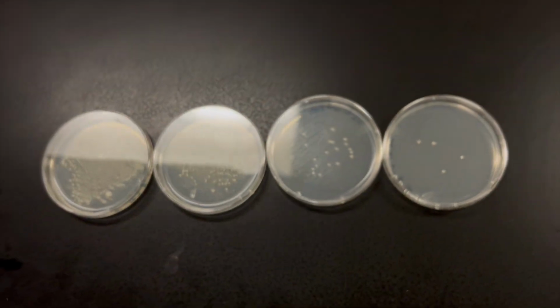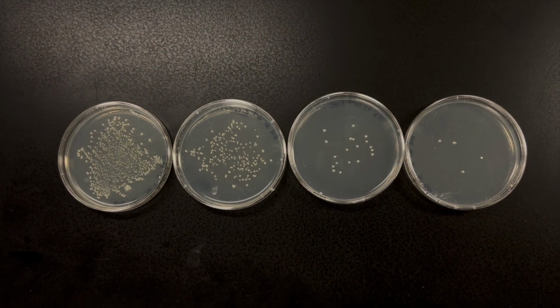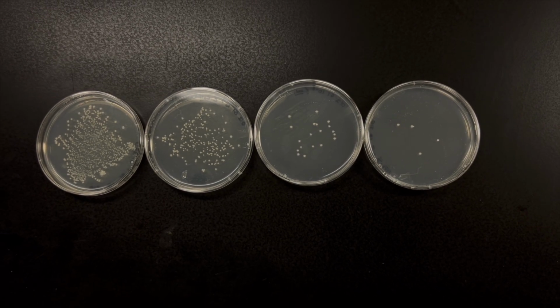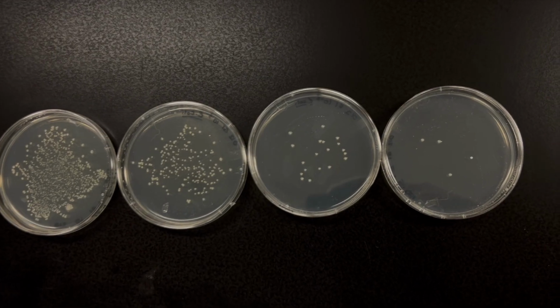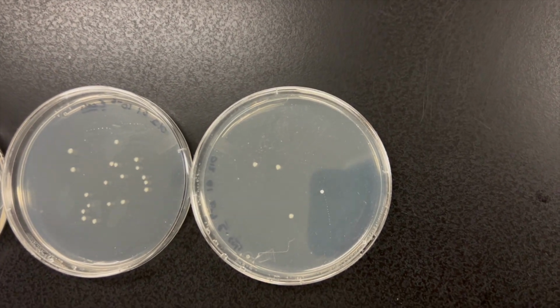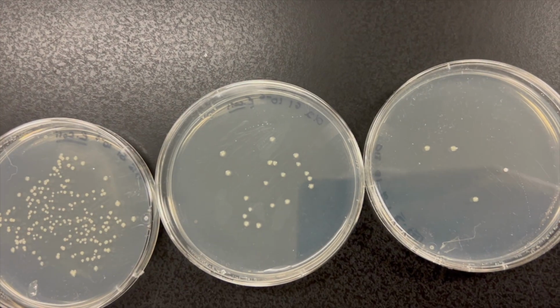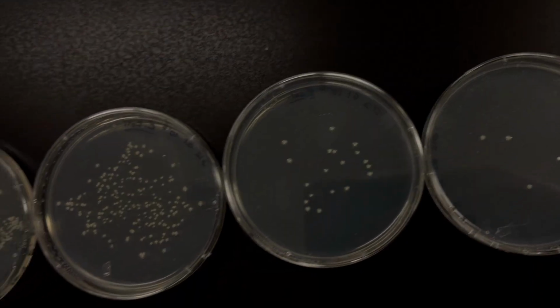So out of those 4 plates, what we're looking for is trying to count the plate that has between 30 and 300 colonies, okay? And so you as a student making this lab up, you have to figure out which plate to count, and then you want to count that plate. So we'll do a close-up of each plate so that you can go through and make those counts. Each of those dots is a colony. Each colony then is made from 1 bacteria on the plate growing out into the whole colony. That colony is called a CFU, or colony forming unit.